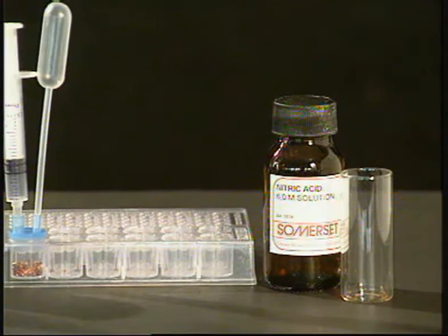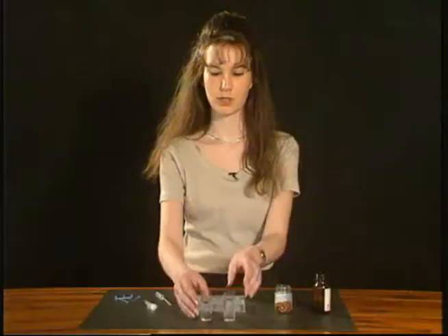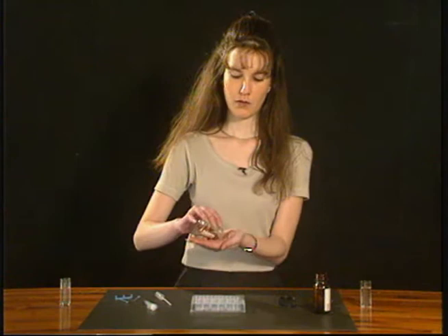Before you begin this experiment, you need to prepare a container of cold water and a container of hot water. First, fill about a third of well F1 with copper turnings.